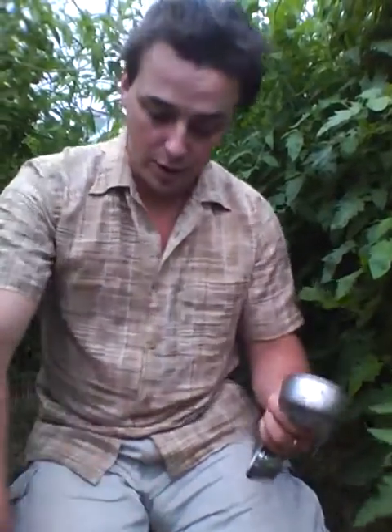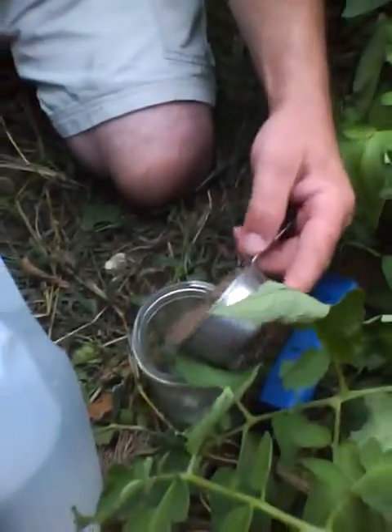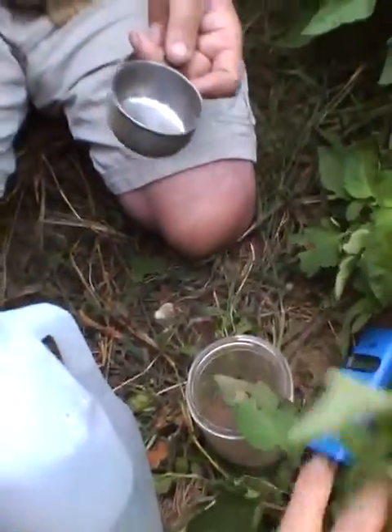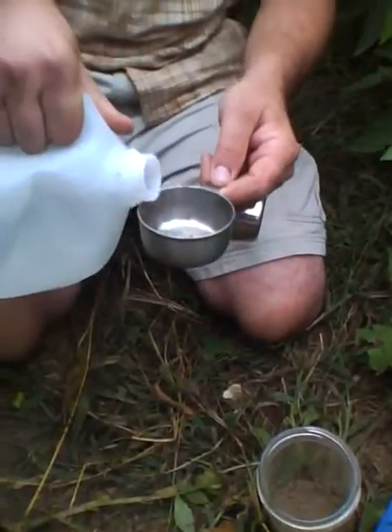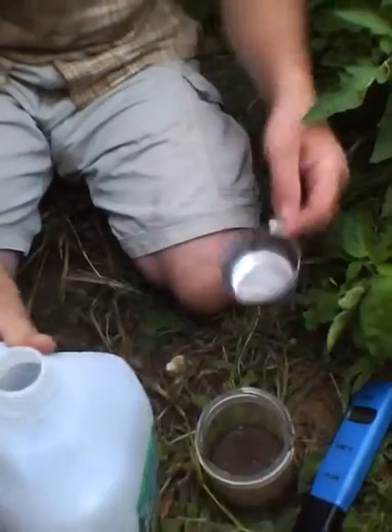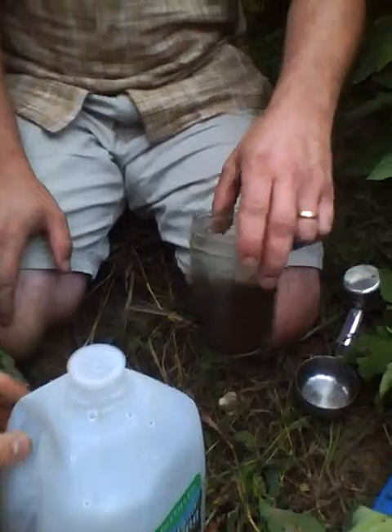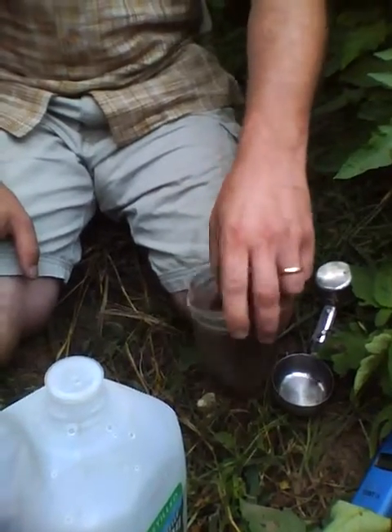I'm going to show here in very simple fashion how one takes a conductivity test with this specific meter. It's one part soil — which is obviously too dry — one part distilled water, shake it up, put the meter in and get a reading.